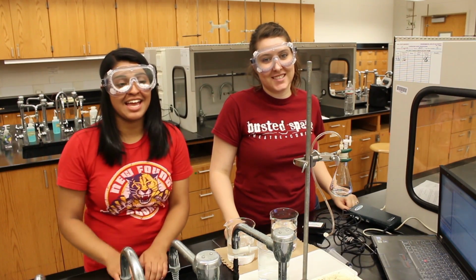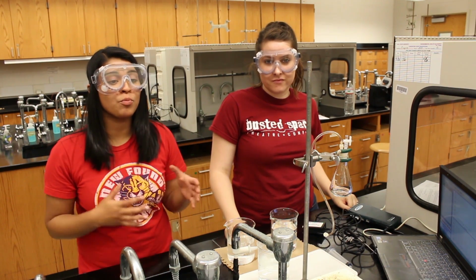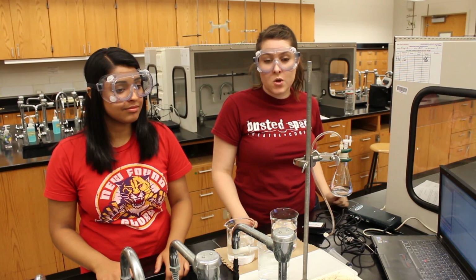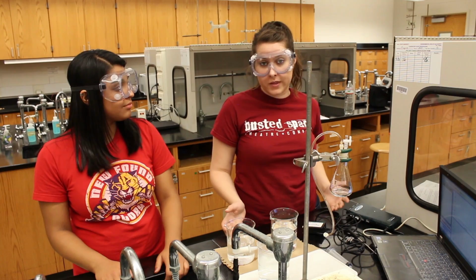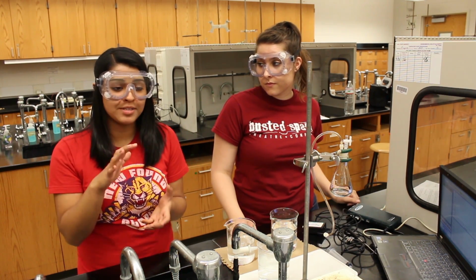It's Sadie and Katie again, and we're going to help you go through the gas law lab, where we will be investigating both Boyle's and Gay-Lussac's laws. Boyle's law deals with pressure and volume, while Gay-Lussac's law deals with pressure and temperature. Both of these laws deal with gas pressure. In today's lab, you'll be measuring the pressure of a trapped gas.